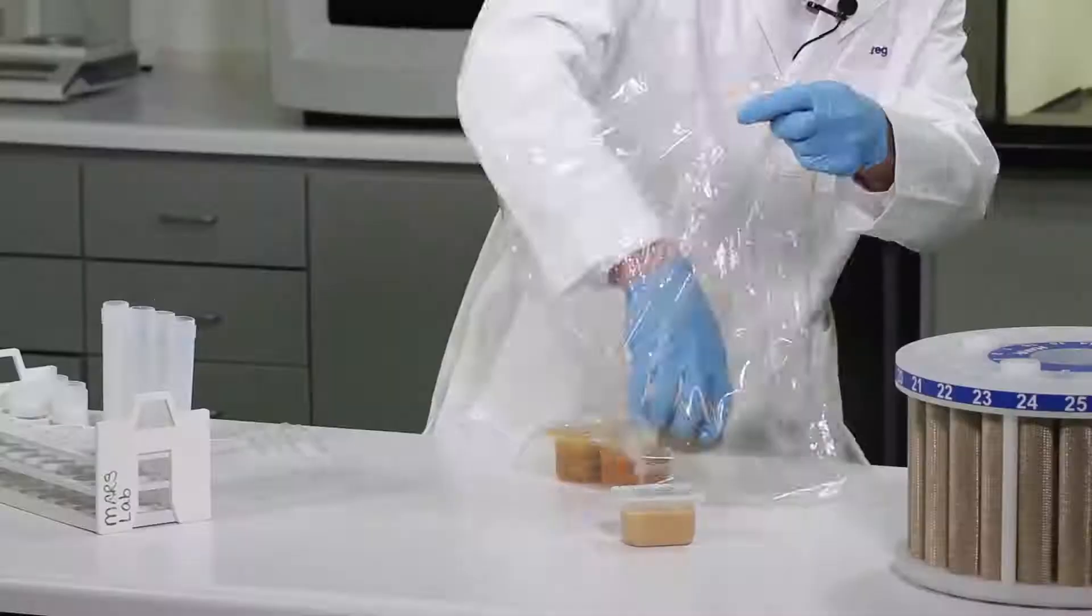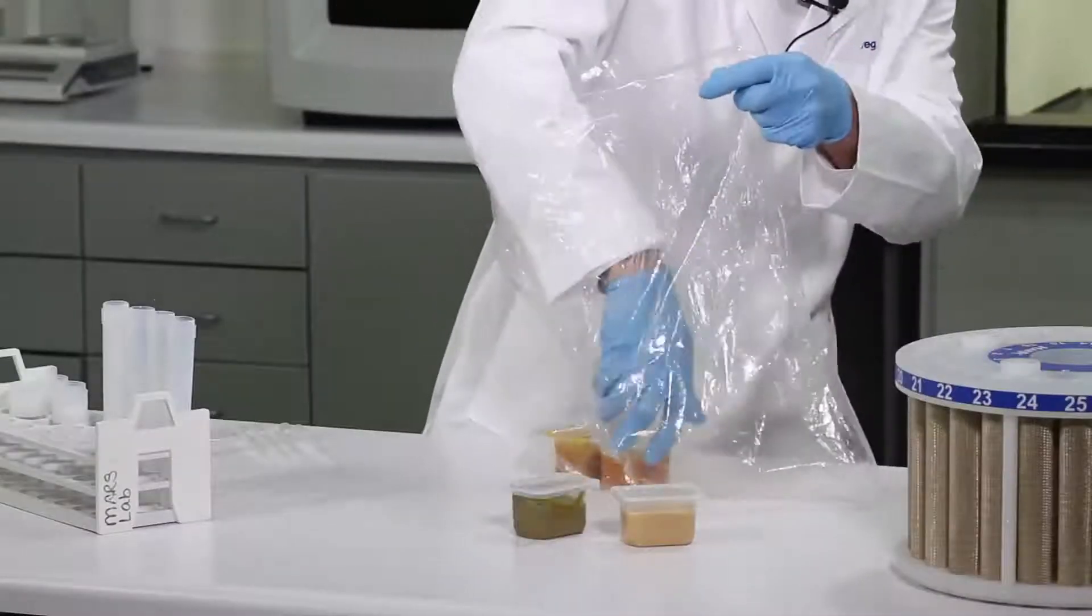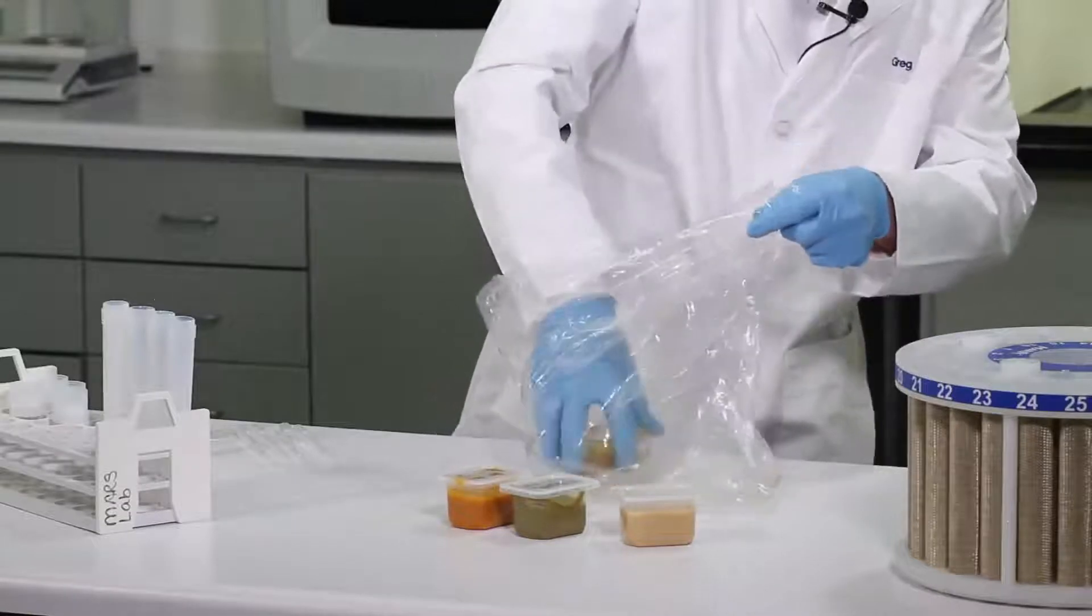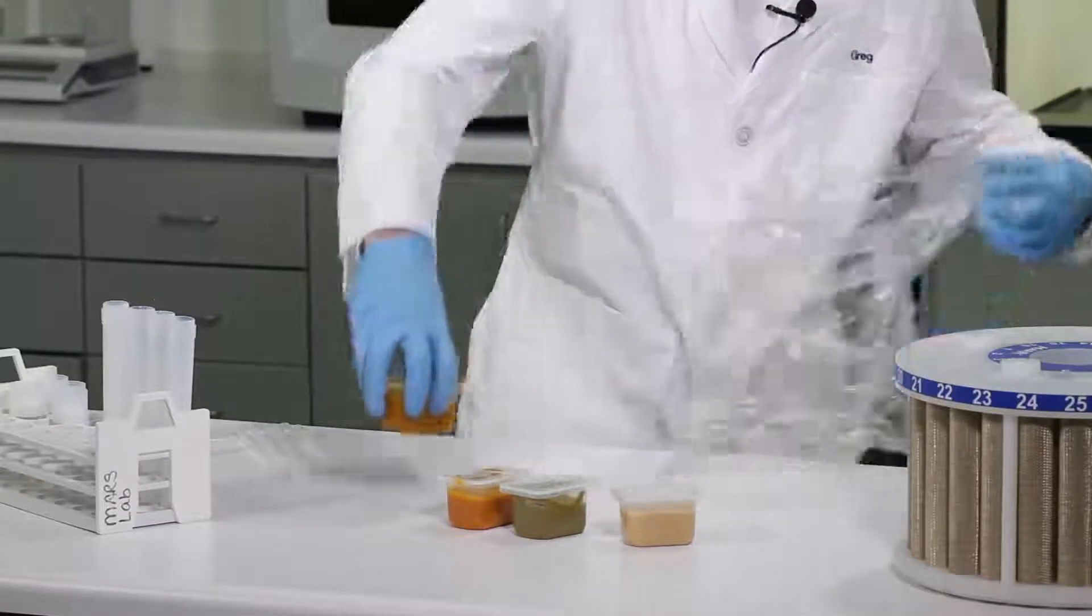We've got some samples of banana, green beans, sweet potatoes, and everybody's favorite, pumpkin.